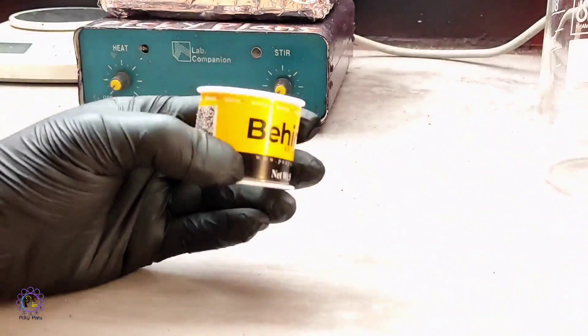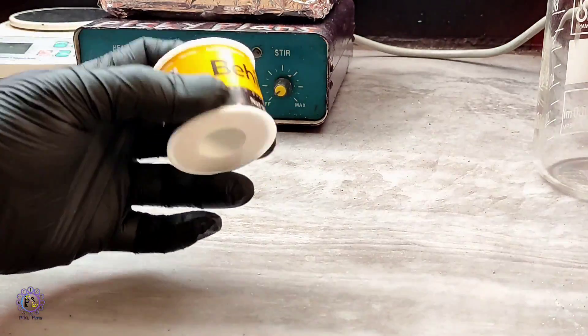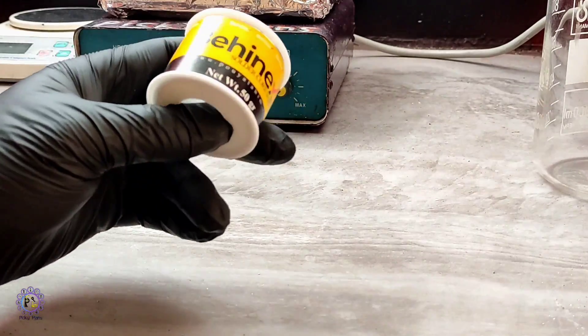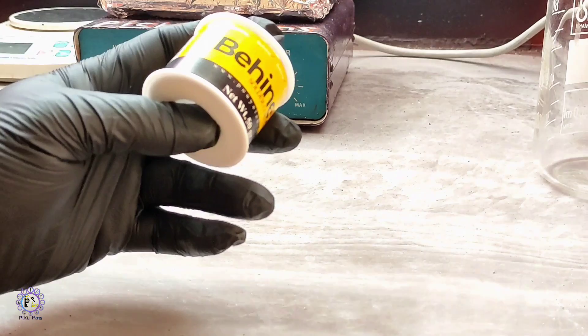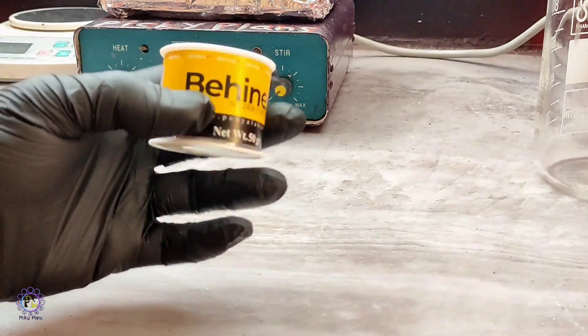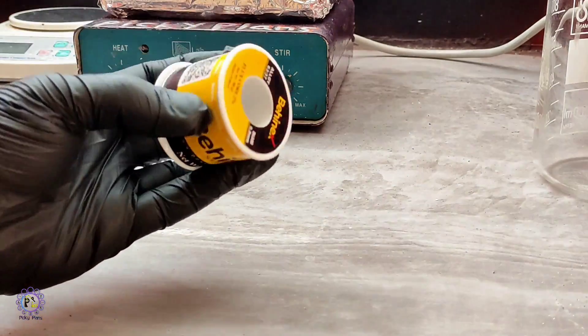Hello Waddies! Hope you're doing well. In today's project, I want to separate tin and lead metal from this solder wire. You may not find this process an economical way to get tin metal or even lead, but I'm just trying to do some chemistry and explore science.